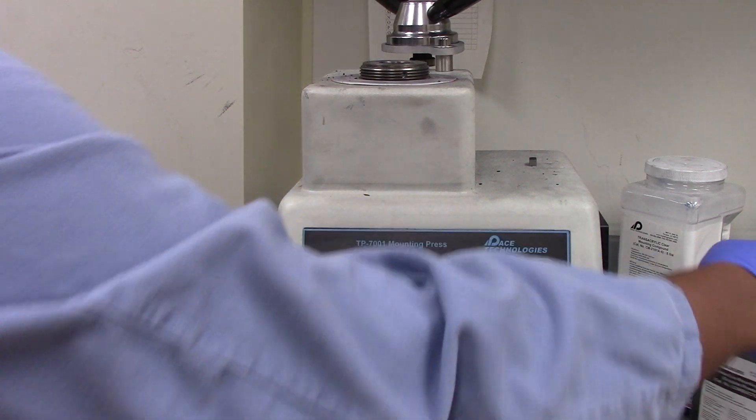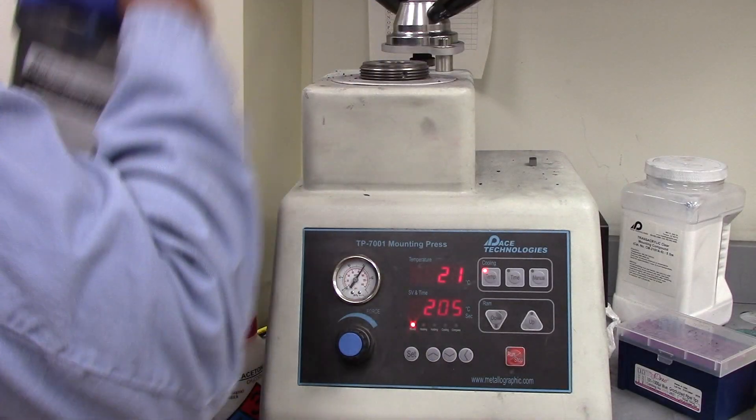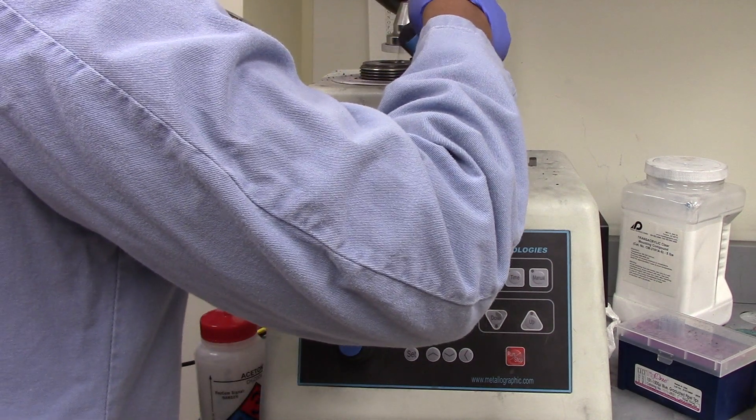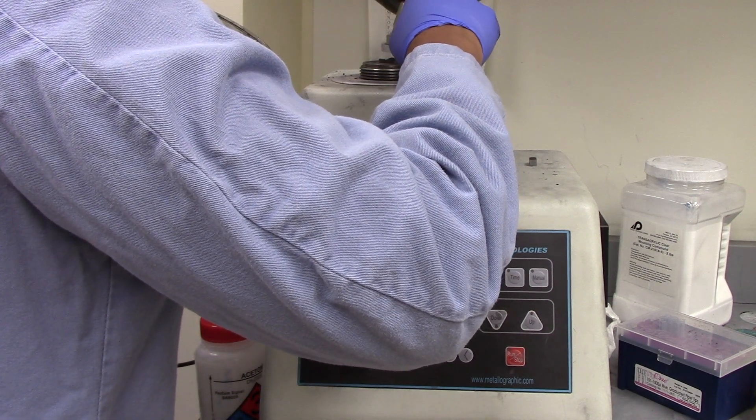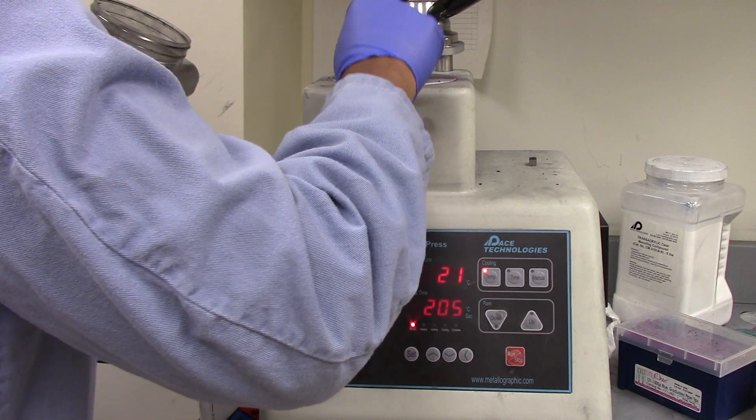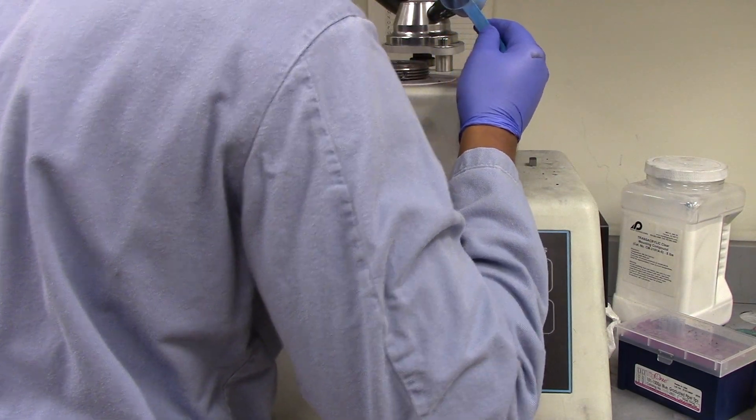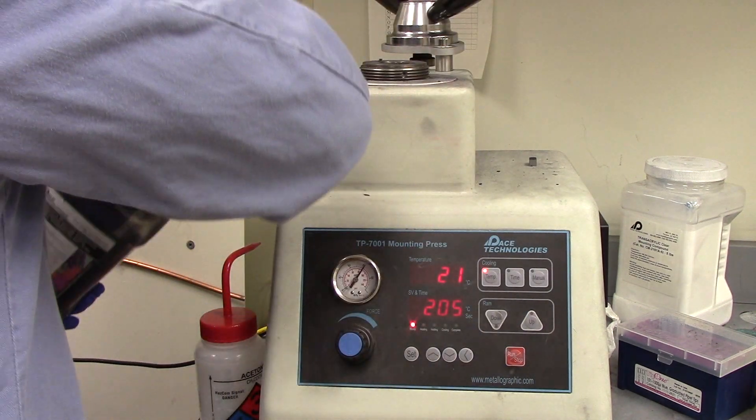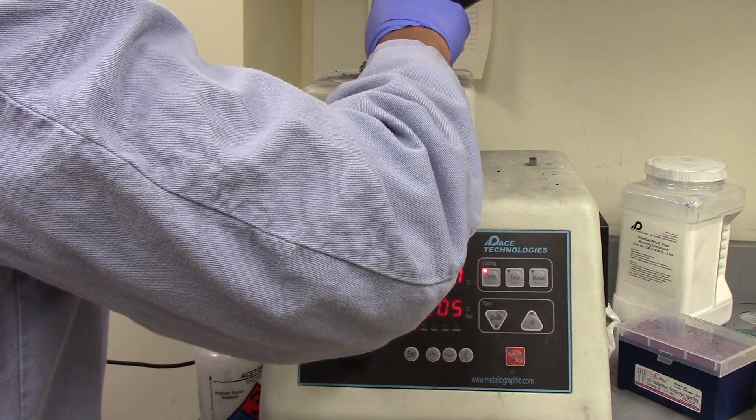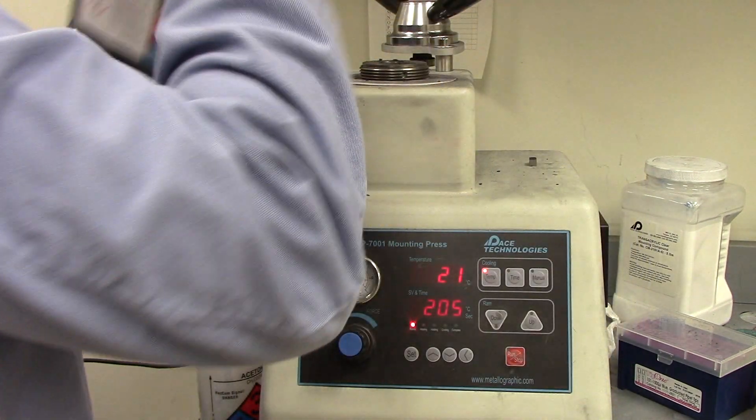Now, with this conductive mounting compound that I have over here, I'm just going to take enough of it so that the compartment here is about three quarters full. That should be enough mounting powder there.